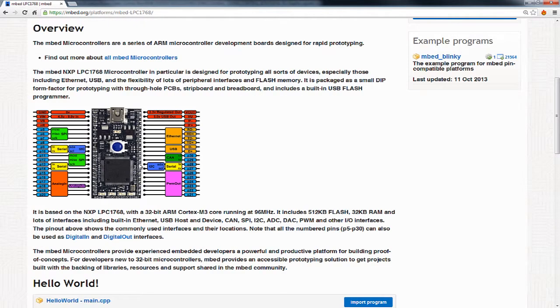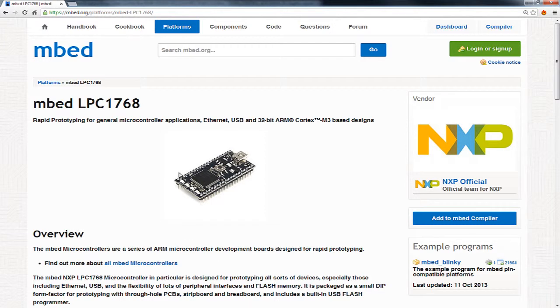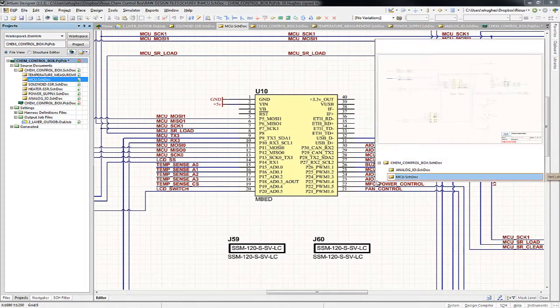So it's similar to, say, an Arduino. The big difference is it's a lot faster, a lot more powerful, and it has a lot more I/O. And pretty much all of the I/O on this Embed is used for the Rioux control box. So this is what, at the heart of the design from a programmer's perspective, you need to know about. In the schematic, that's what this block is, this Embed microcontroller. Then I just send out all of the I/O to all of the chips on the board that implement our different functions.